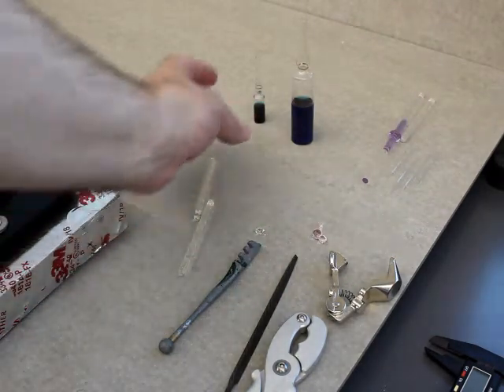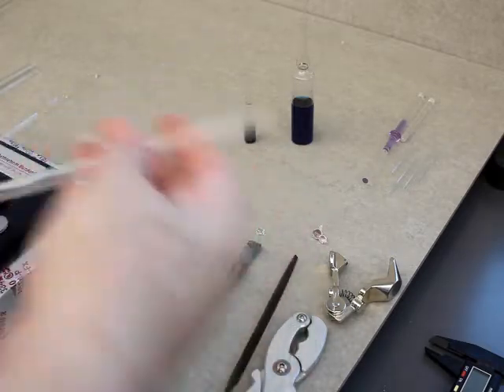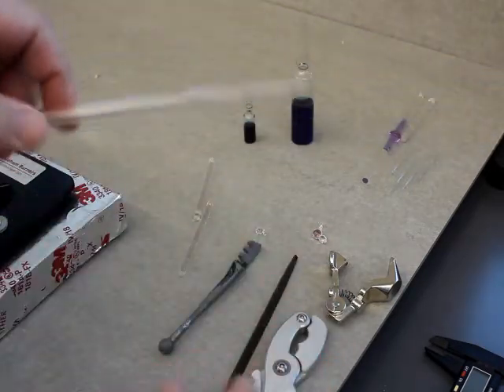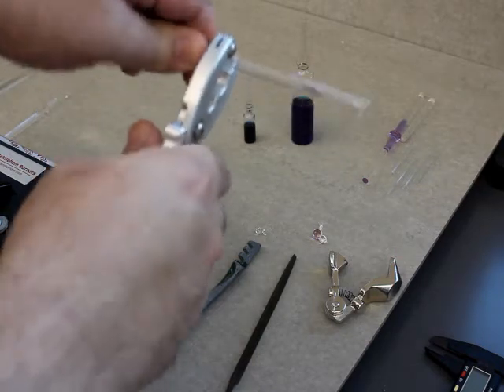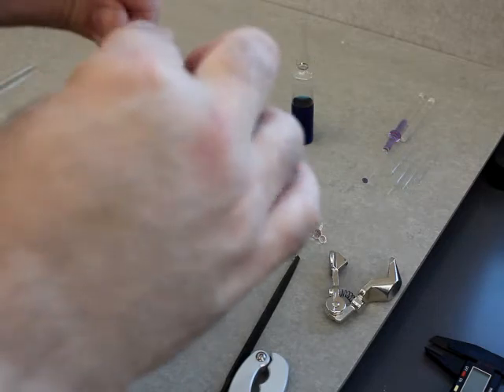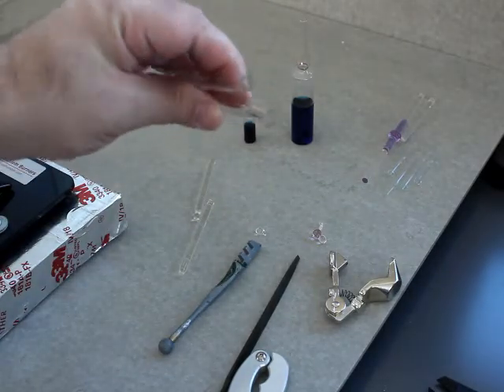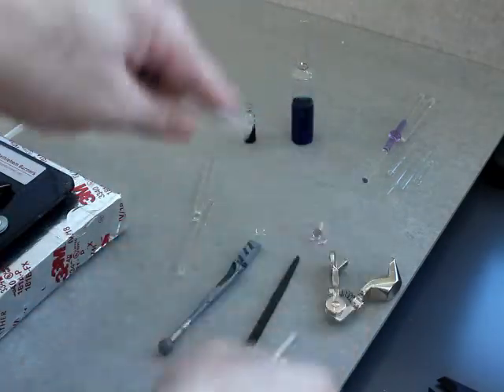I gave my story of having to pop open the ampule, but there are also many times where you'll have a piece of glass tubing or rod that for whatever reason needs to be cut. This is some scrap tubing where either I or a student fused it here for a test exercise. So it would be the same idea: take this, find where I want to score it, place the scoring blade here, rotate — and I've got a really nice score right there. Put a little bit on there, and there it goes. This was nine millimeter glass tubing, just standard wall tubing, and scoring and snapping it was a piece of cake.